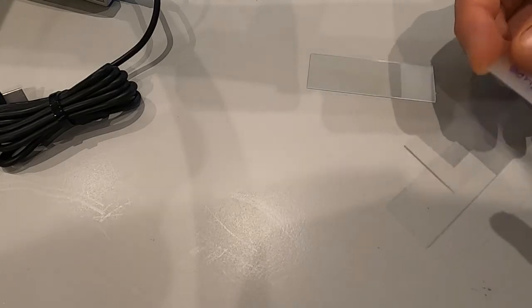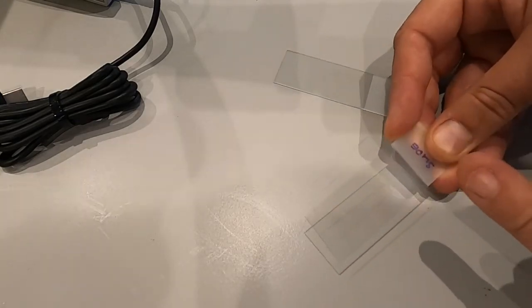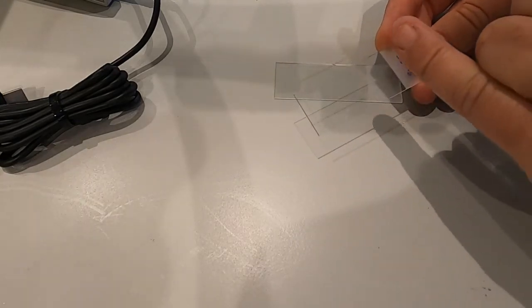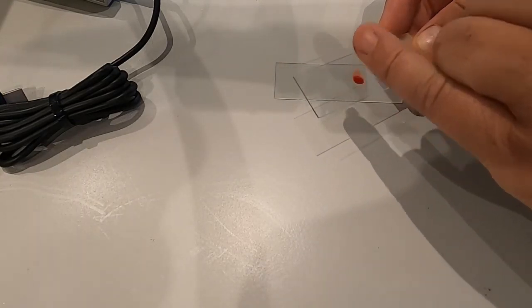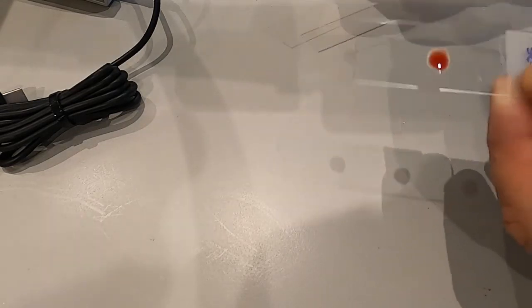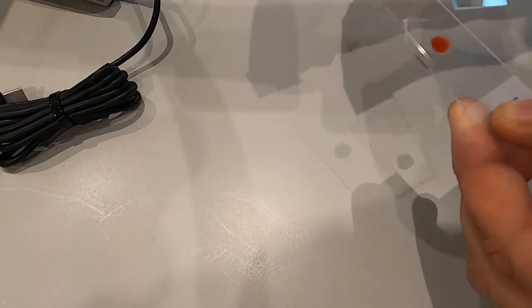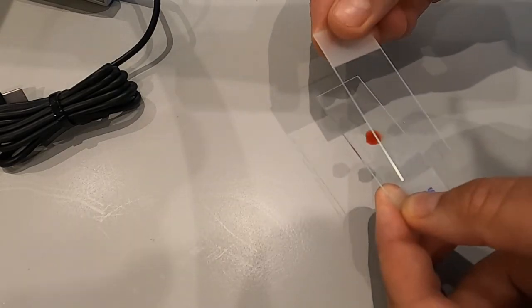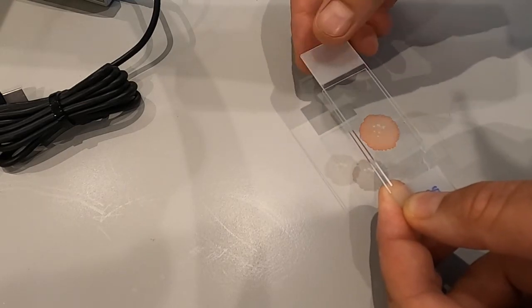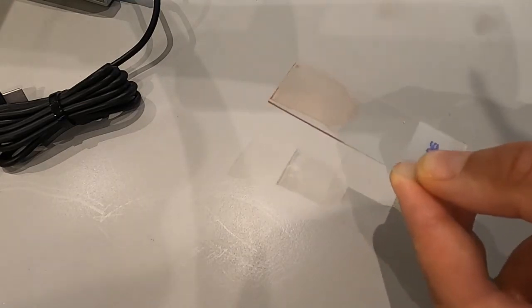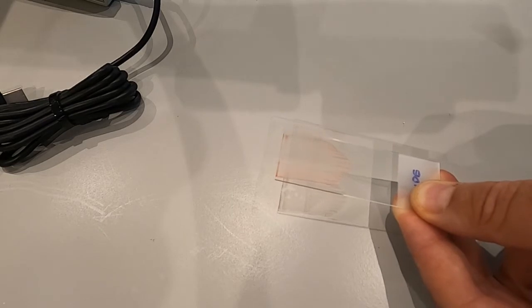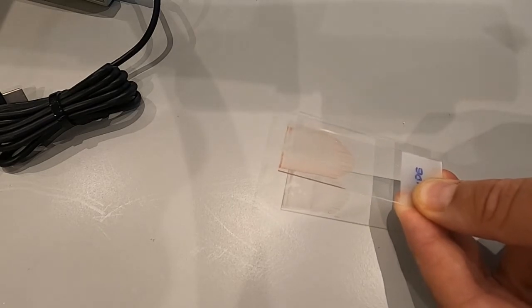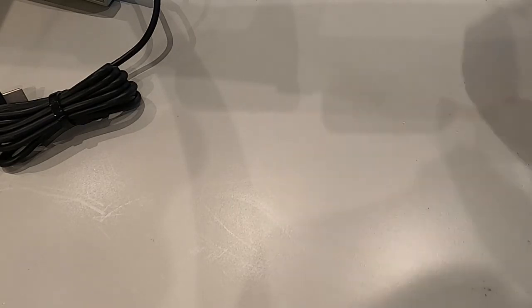This time, place the drop of blood directly in the center of the slide. Then place the other slide on top, let it rest, and pull. There you have a foolproof, 100% usable blood film.